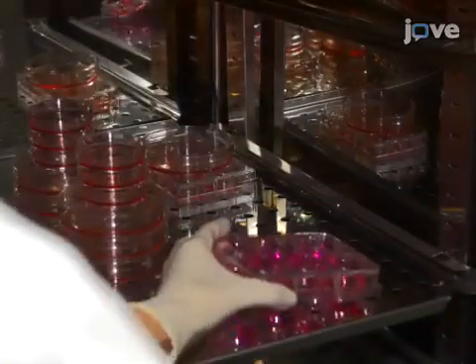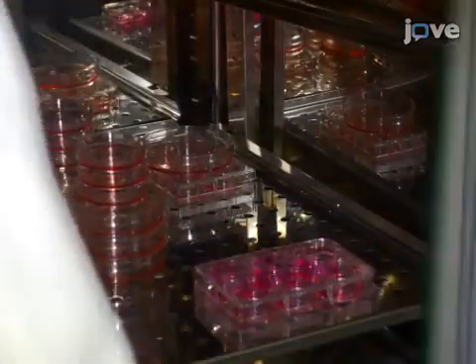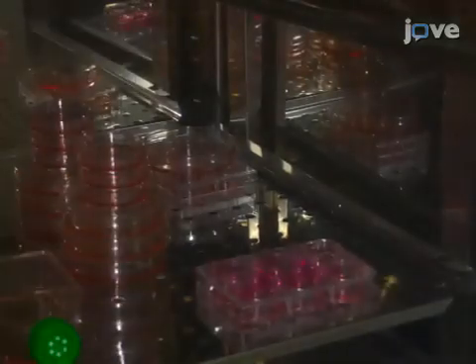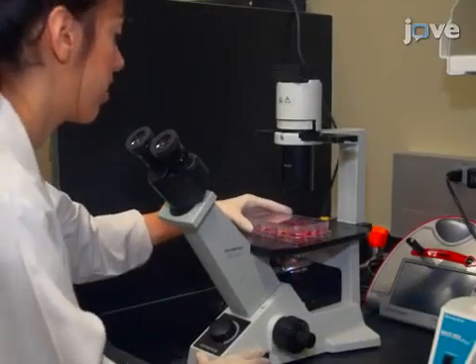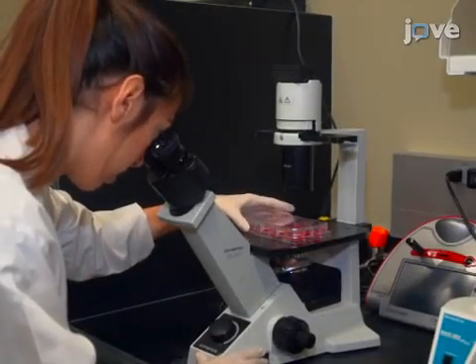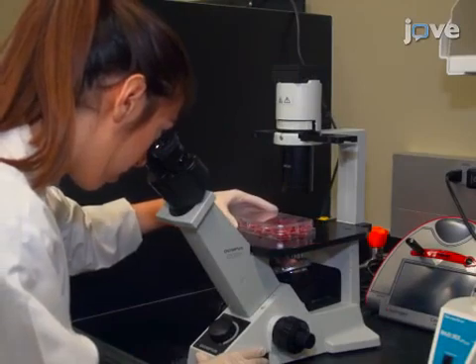Return the plate to the cell culture incubator for 4 hours. Then, check the cells under a microscope for changes in their morphology and attachment.